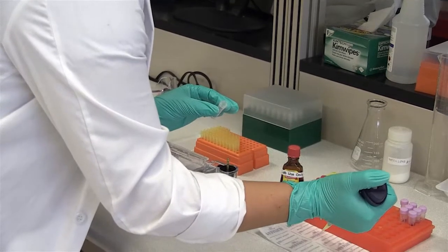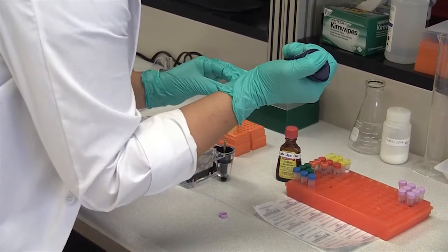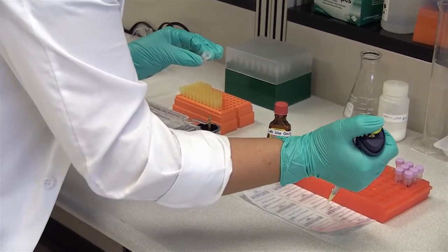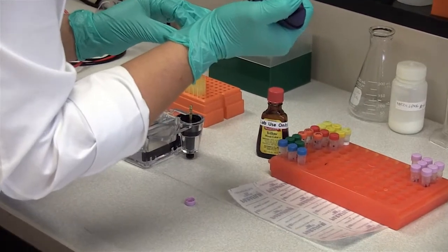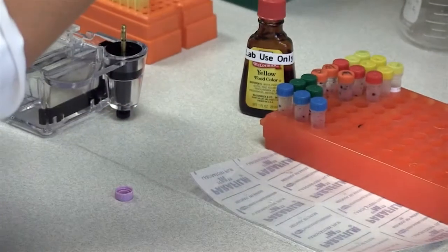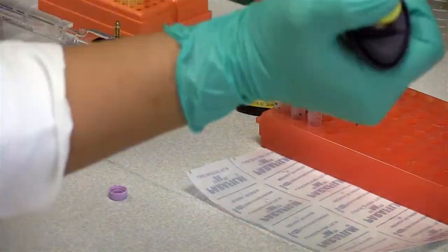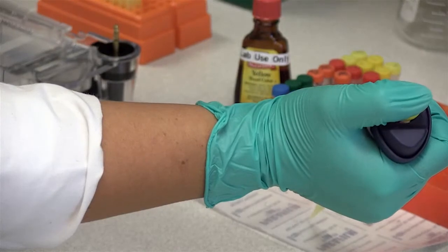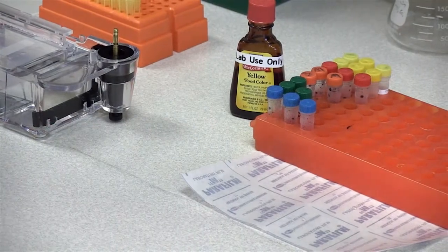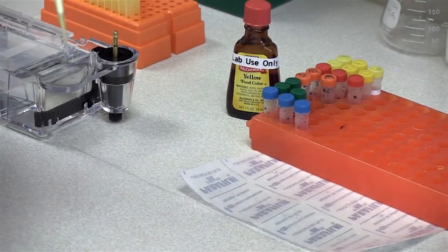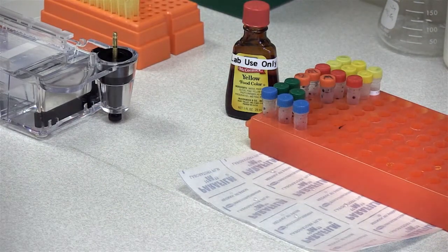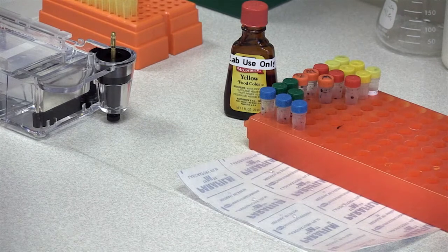So what I've got now is five individual glycerol and deionized water solution. So that we can go ahead and start with adding your food coloring.